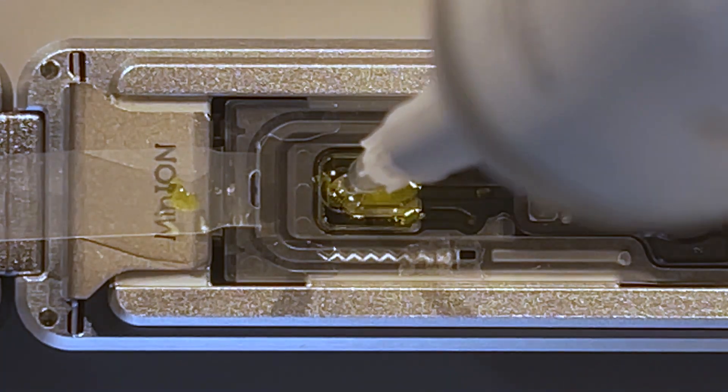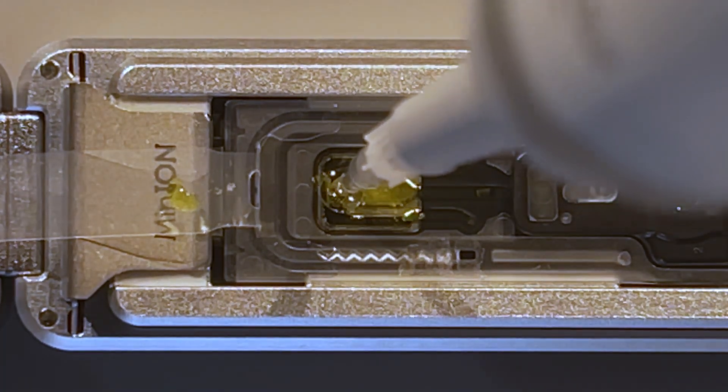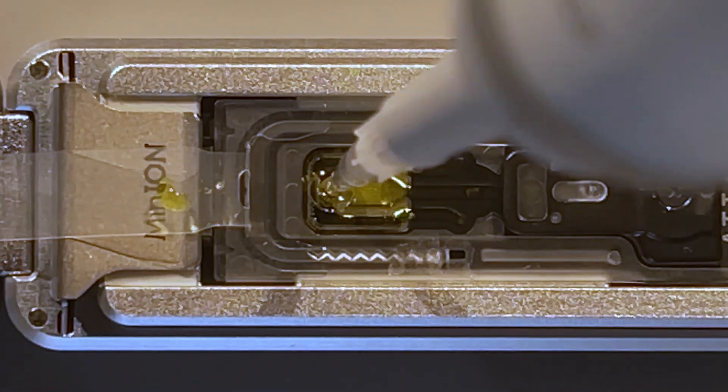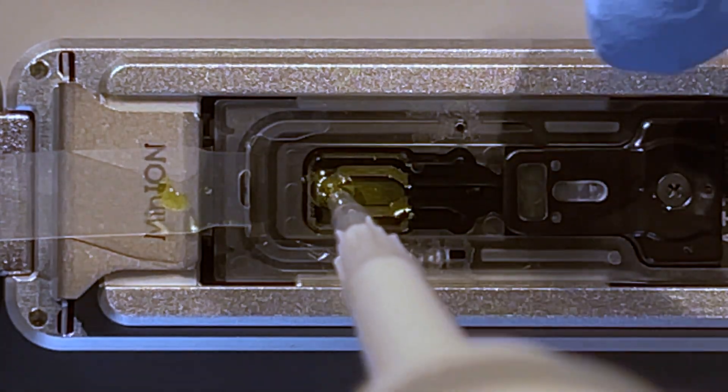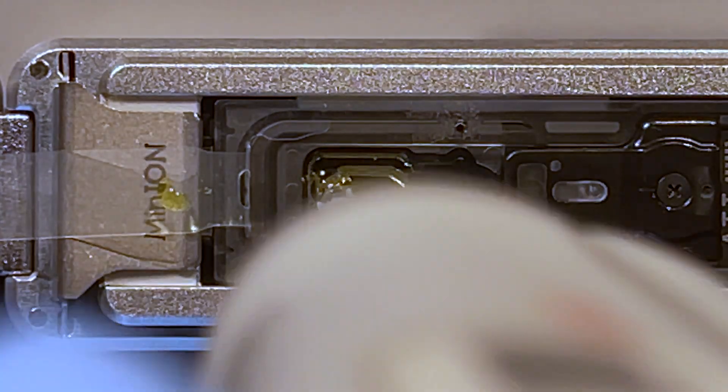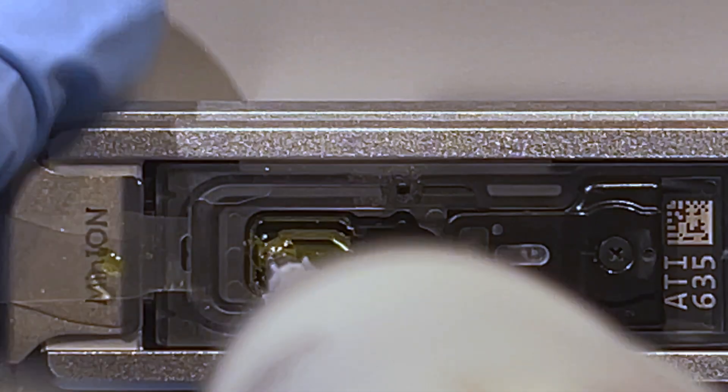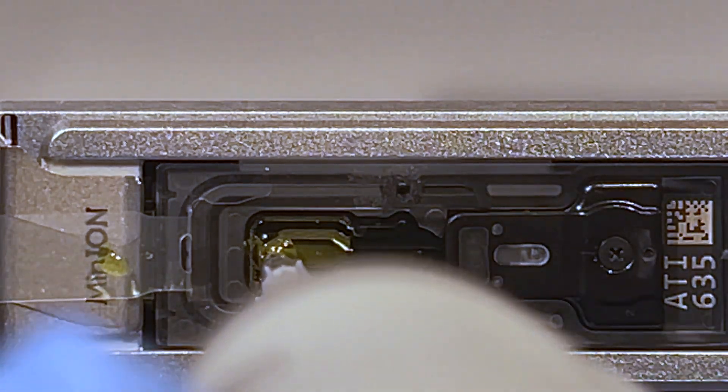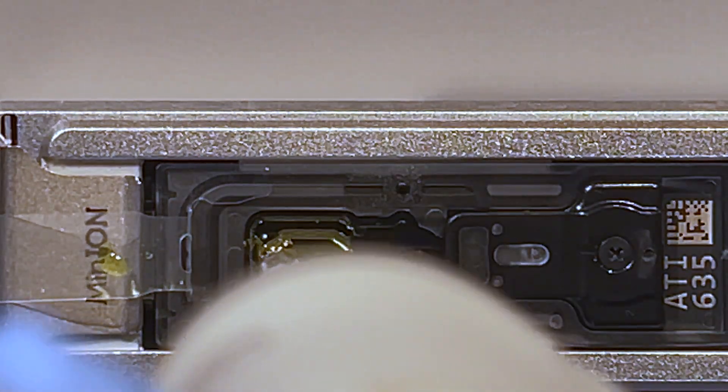So you want to make sure your tip—there's no air bubbles in there. Okay, that tip goes directly into the hole. You can feel it kind of fit its way in there. And then I don't press down on the pipette button, but rather I just turn the volume down, which is the equivalent. When I'm doing this, I'll try to do it a little bit at an angle so I get that high-resolution shot. I shouldn't see any liquid pooling at the base of the tip, but rather in the pipette. And then actually, what you'll notice as you're doing that is that there'll be a little channel of liquid that'll start flowing up the side there.